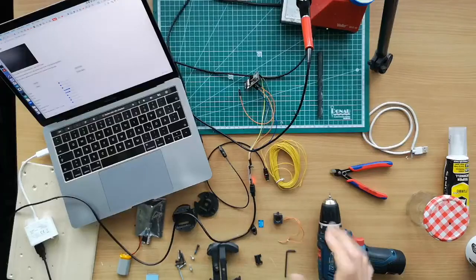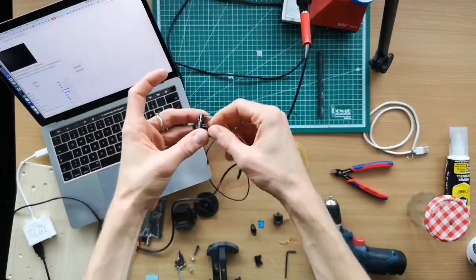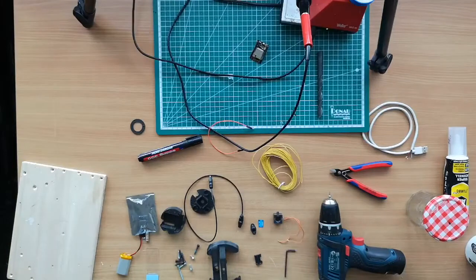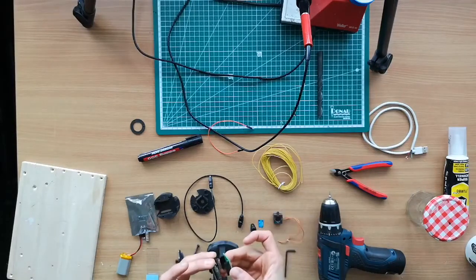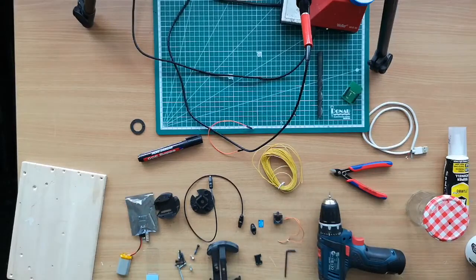Okay, since we're done with the flashing part, we can continue. So I just disconnect the assembly here from the computer and also remove the computer. So now we're continuing with the camera. This here goes into the base. And I have one part which you probably don't have, but this usually goes, it looks very similar to the programmer. So now we continue.